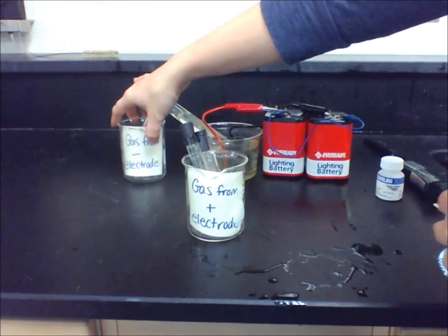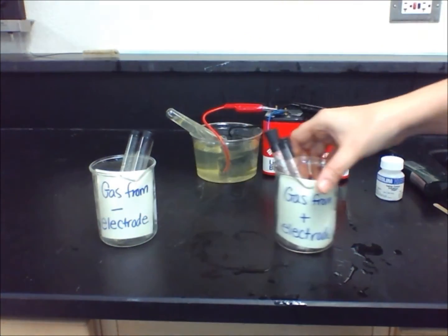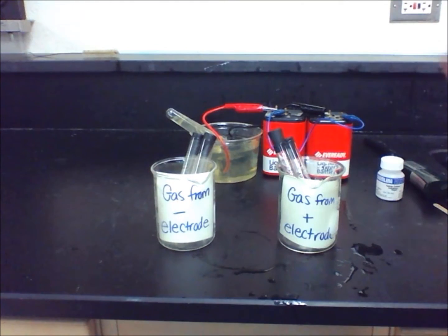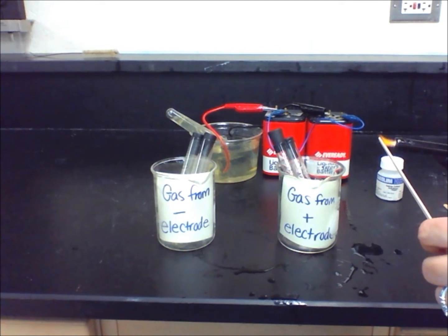Once you or your teacher have collected enough gas, we need to conduct a test to identify each gas and determine its properties. Make sure you disconnect the battery. Carefully remove the test tubes, and we have done this ahead of time for the purpose of this demonstration.